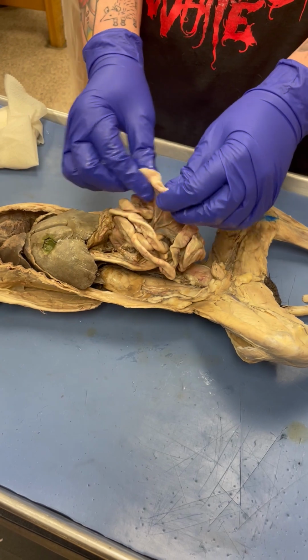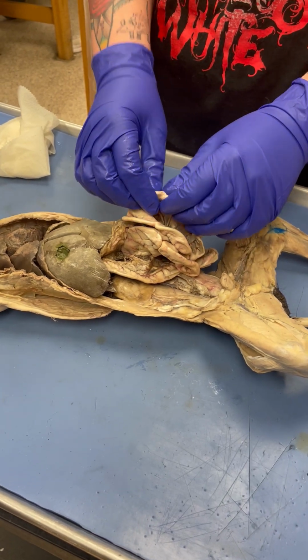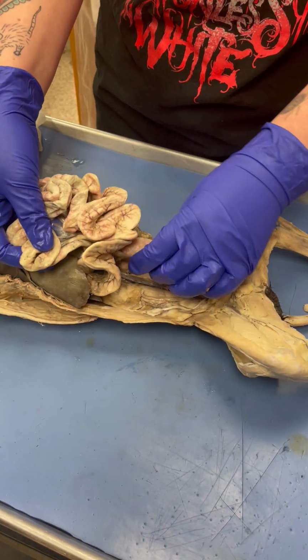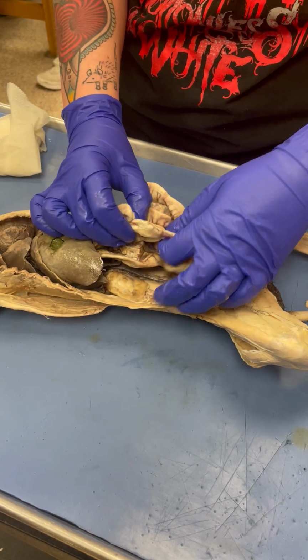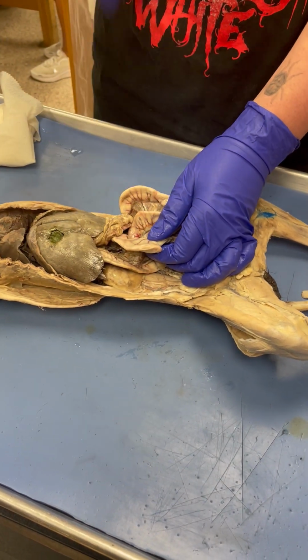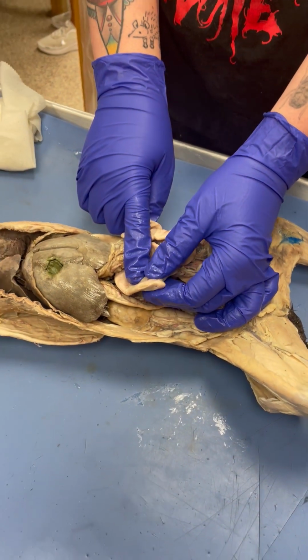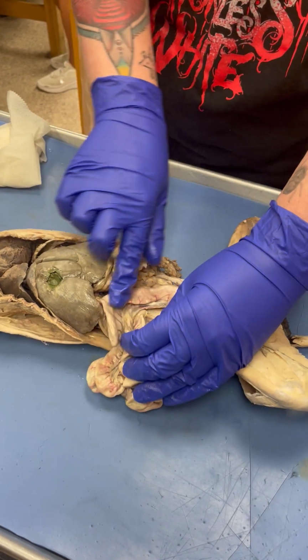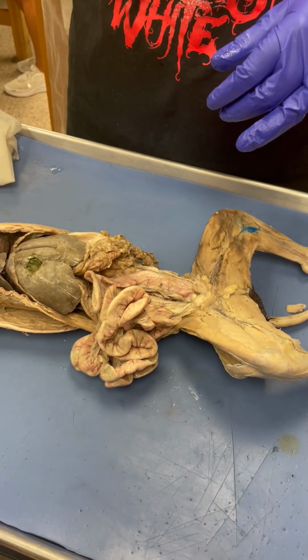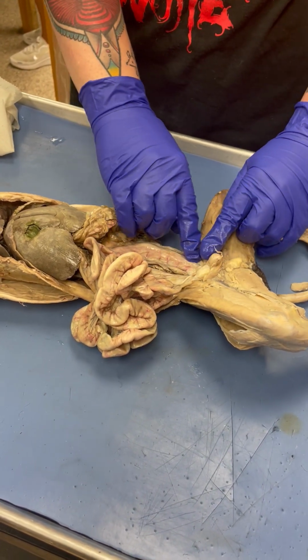What's the middle called? Jejunum. And what process takes place there? Absorption. And then you also have propulsion as well. And then the last part of the small intestine, so this area here, this is the ileum. And then you enter the large intestine. So the curve where you enter the large intestine is called what? Cecum. Cecum, yes. And then this whole thing on the cat, this is all just colon. On the human, if I asked, you would label the part like ascending, transverse, descending, sigmoid. And then that runs down, and about right there, you kind of see that muscle tone change.